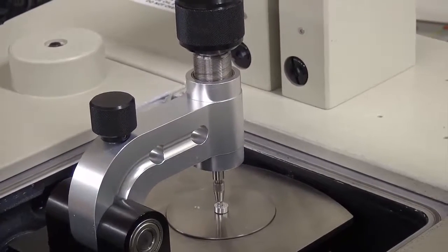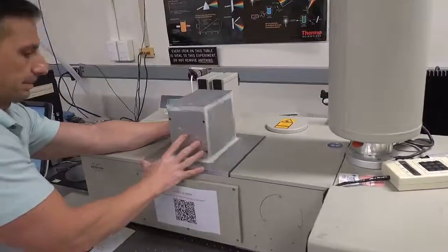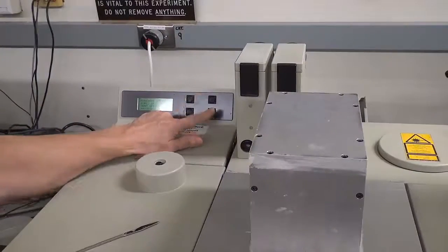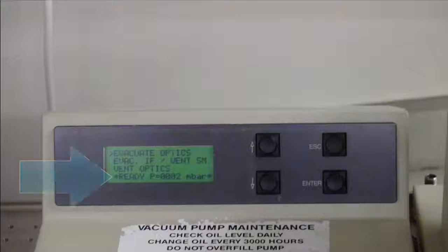Put the lid back on, and then evacuate the system. You have to wait until the system says ready before proceeding. At this point, you are ready to collect your sample.